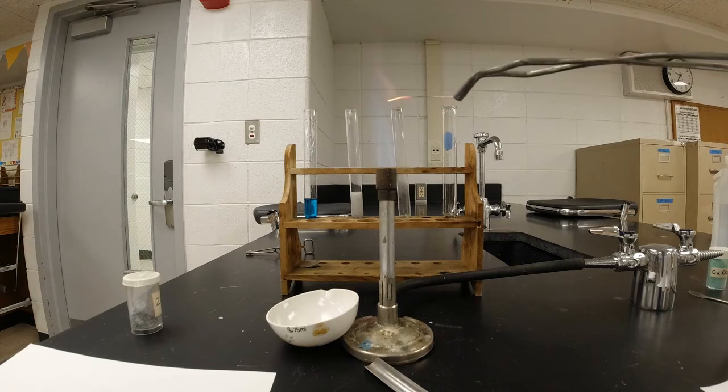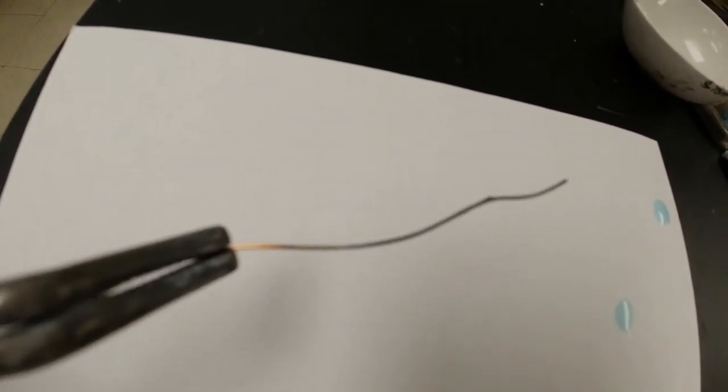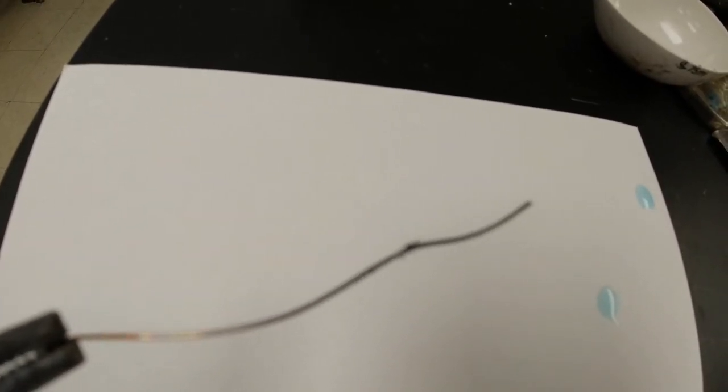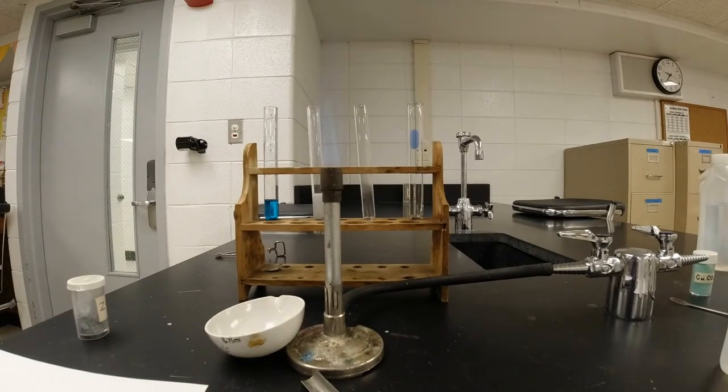All right, that's probably long enough. And if I look at it, it isn't coppery colored anymore. Now the end is black. All right, what is that black stuff? That's a combination of the copper with oxygen from the atmosphere. So the heat actually allows oxygen to attach to the copper metal. All right, write down what you need to, pause if you need to.